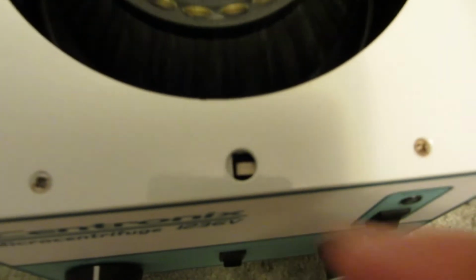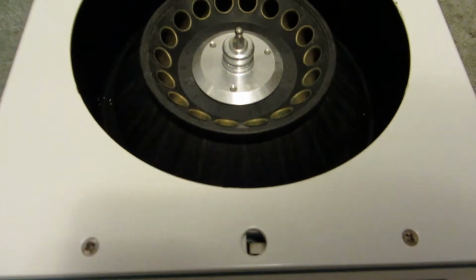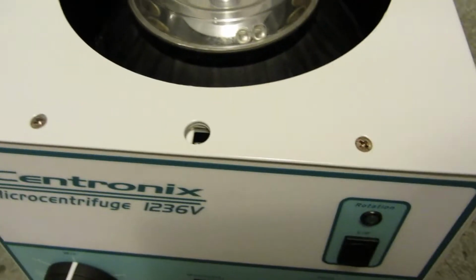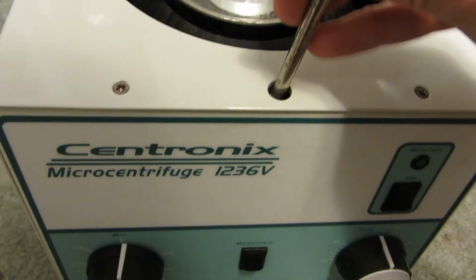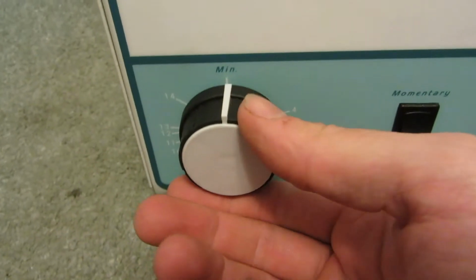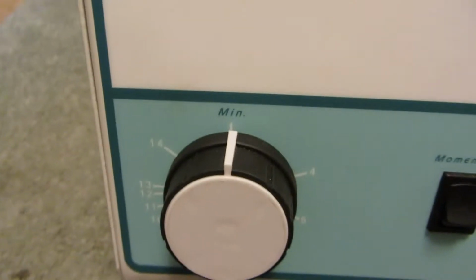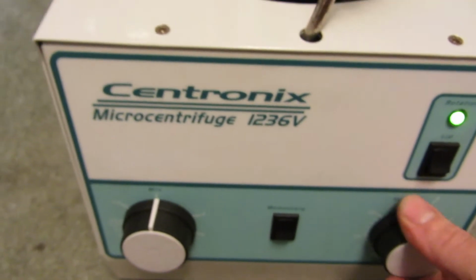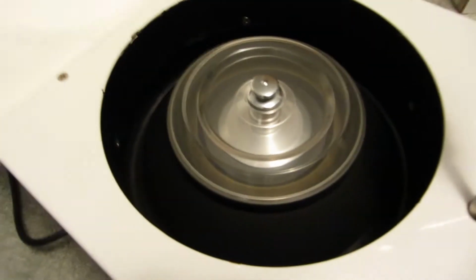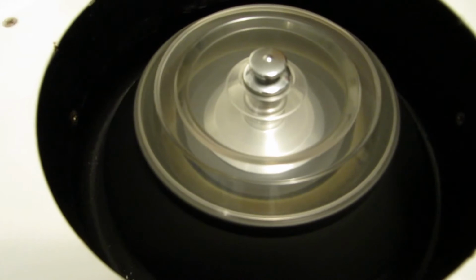And there's a protection switch in here. This won't run unless the lid is closed. But I will circumvent that just to show you guys what it's like when it's running. So we'll set the timer. I have the RPMs minimum. That's times 1,000. That's probably about 2,000 RPMs on its minimum setting.